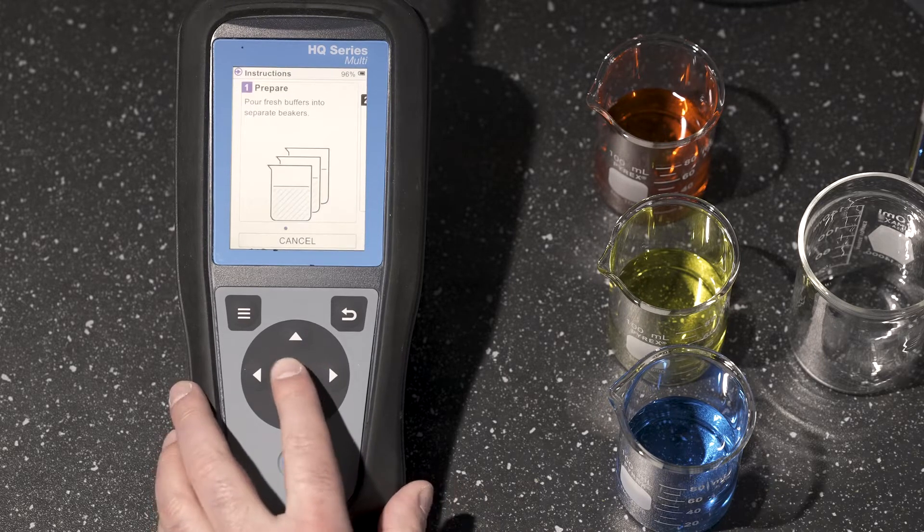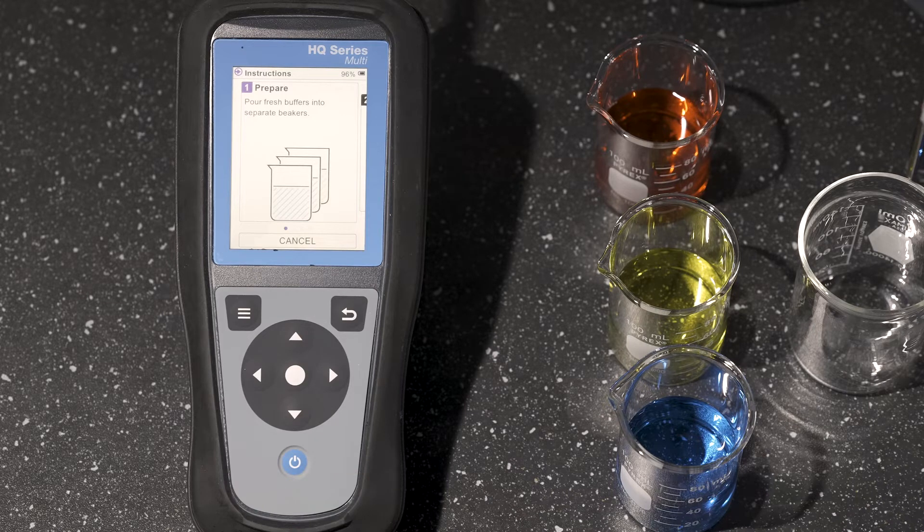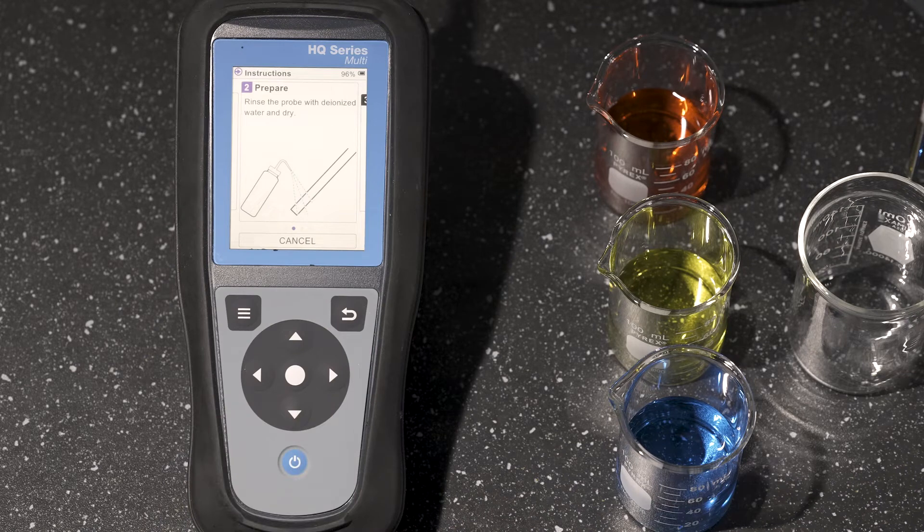I can push continue. It'll let me know step one, pour fresh buffers into separate beakers. Advancing to the right, rinse the probe with deionized water and dry, which I've already done.